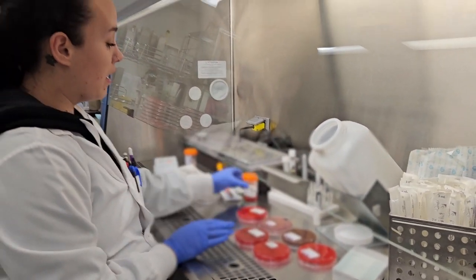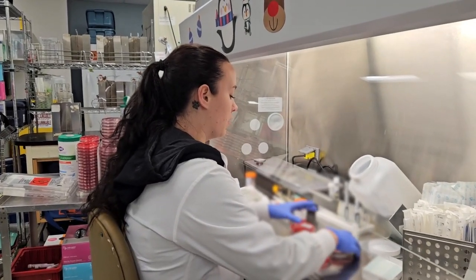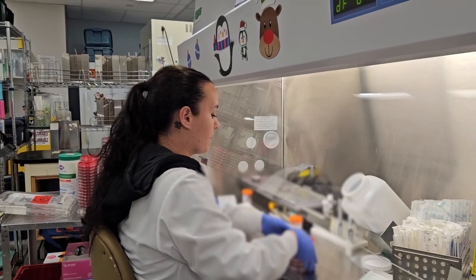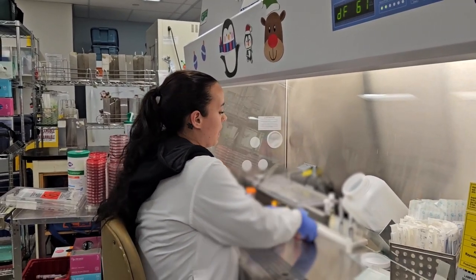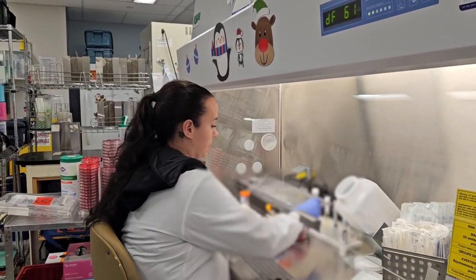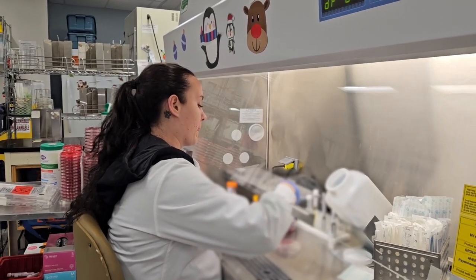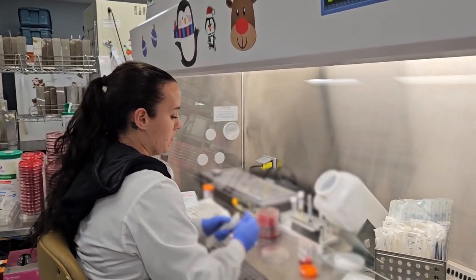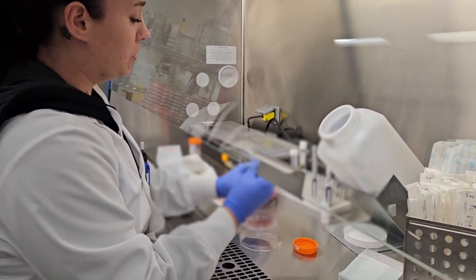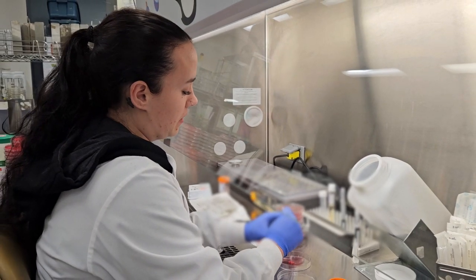So I've labeled them all, I've matched it with our patient specimen here, and I'm going to stack them all and set them aside. And I also have a thio broth here in my tissue grinder container. So what I'm going to do first, open my Petri dish. So I'm going to grab the tissue and put some in our Petri dish here.